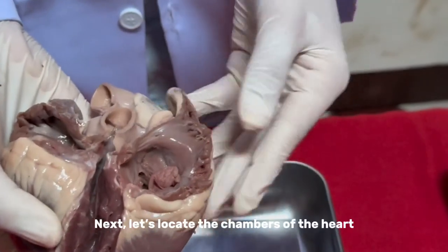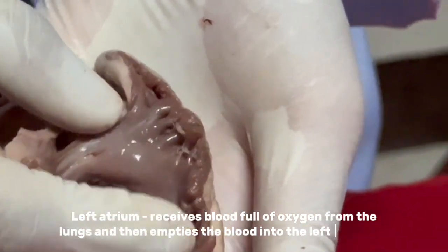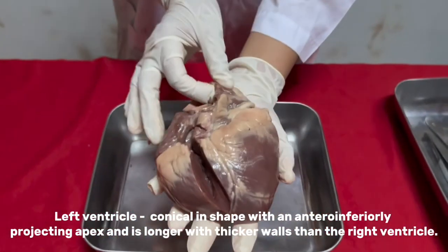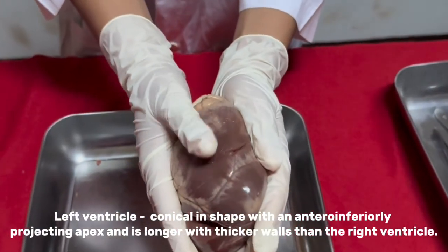Next, let's locate the chambers of the heart. The left atrium receives blood full of oxygen from the lungs and then empties the blood into the left ventricle. The left ventricle is conical in shape with an anterior inferiorly projecting apex and is longer with thicker walls than the right ventricle.